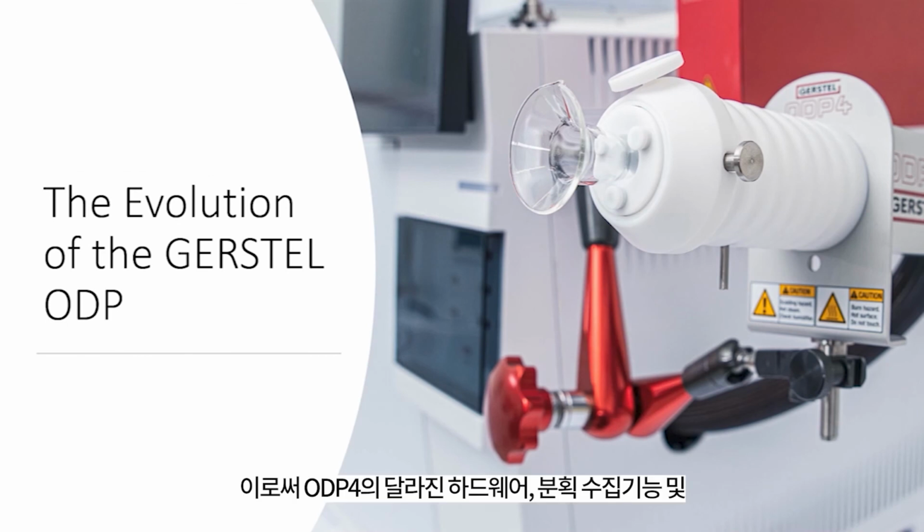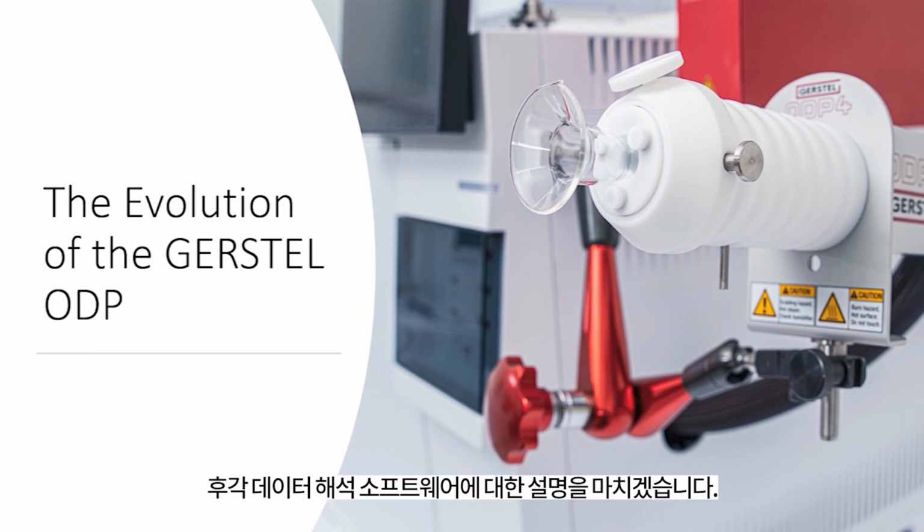This was a short overview of the Gerstel olfactory detection port number 4, consisting of the new hardware, the fraction collector and the olfactory data interpreter software.